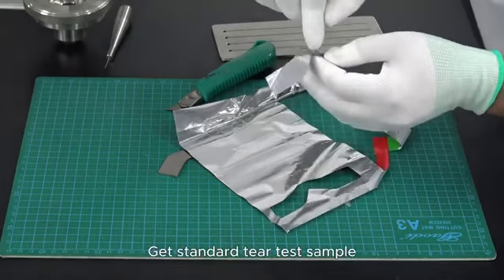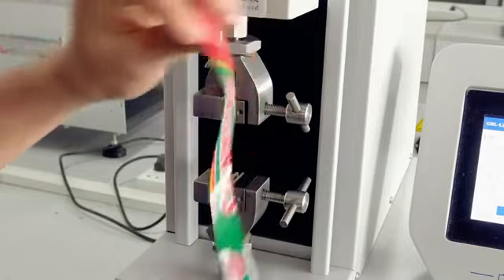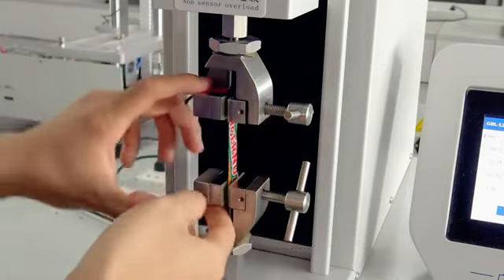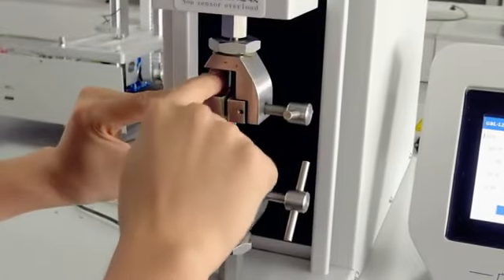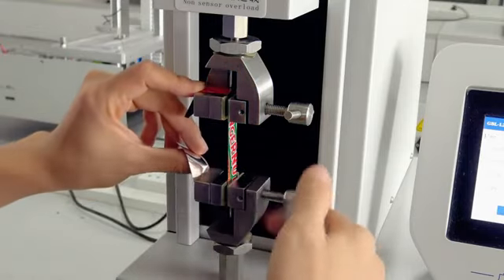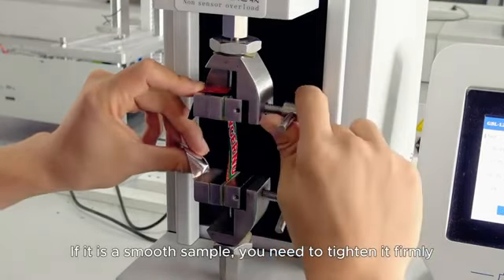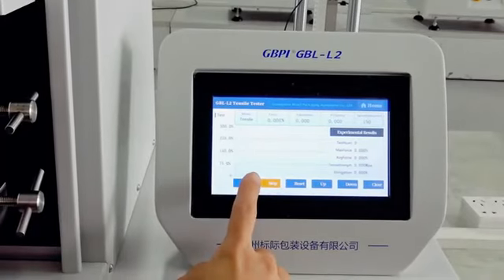Get standard tear test sample. The sample is required to be vertically clamped into the center of the upper and lower fixtures. Clamp the sample gently, no special force is required. If it is a smooth sample, you need to tighten it firmly. Click Run.